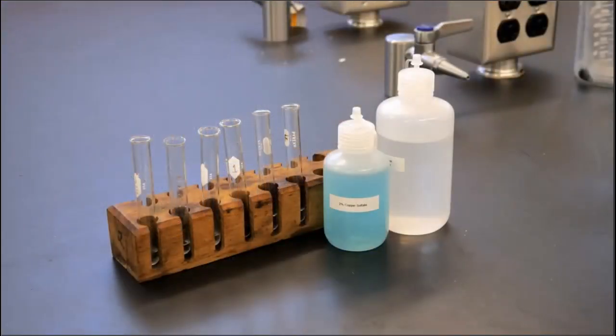So the second test we'll perform is the biuret test for detecting proteins. So we obtain fresh samples of the solutions listed in the xanthoproteic test in 6 15-centimeter test tubes. To each, we will add 5 drops of 6 molar sodium hydroxide and 3 drops of 2% copper sulfate solution. Seal each test tube and shake each mixture. And then after 3 minutes, we will note the colors produced.